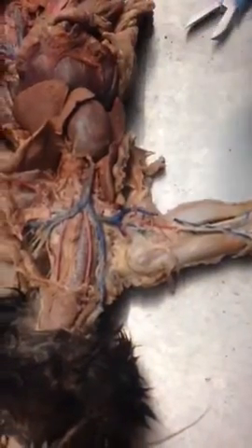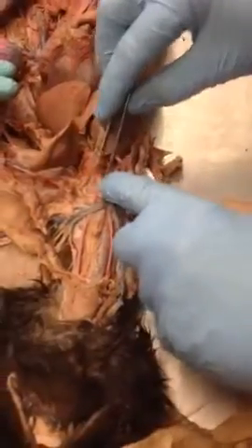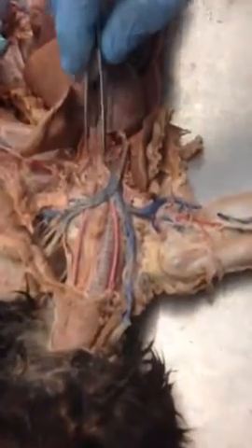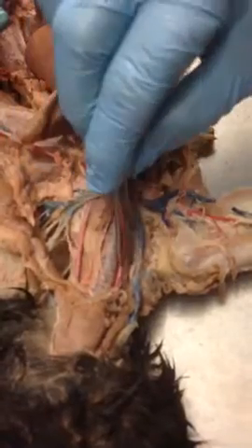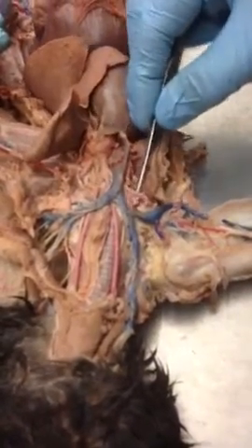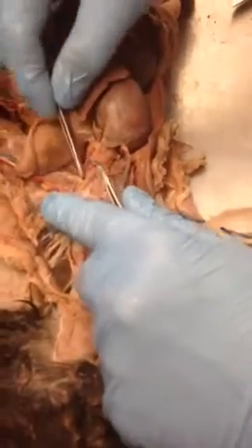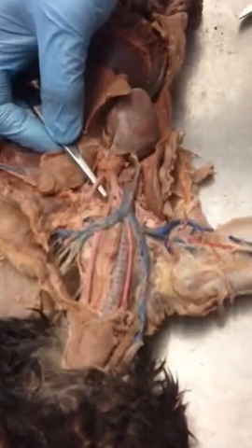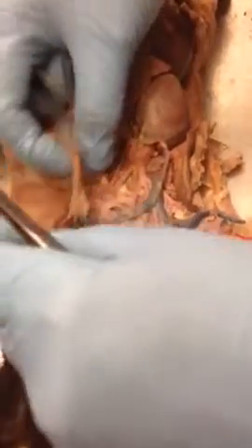So there's a difference between brachiocephalic and brachial. Brachiocephalic is this right here, because cepha means head. So this is going up to the head, these common carotids. Now if this is right subclavian, right common carotid, left common carotid, what do you think this is? Left subclavian, exactly. So left subclavian, and then of course we don't have this cleaned up very well.